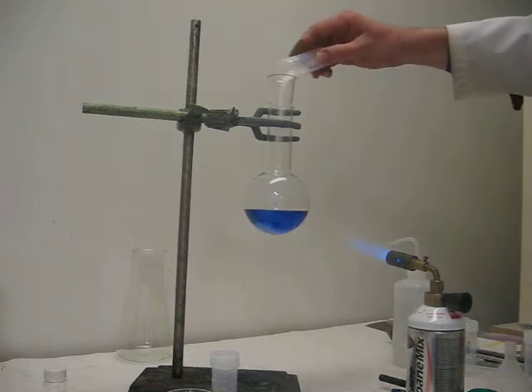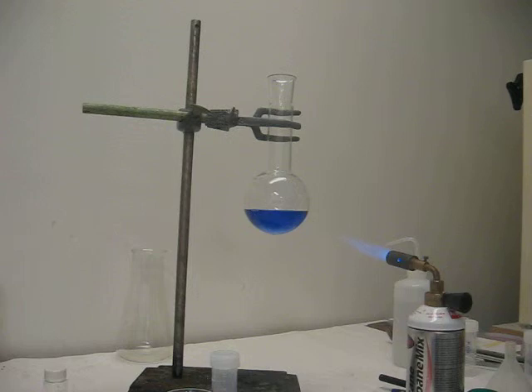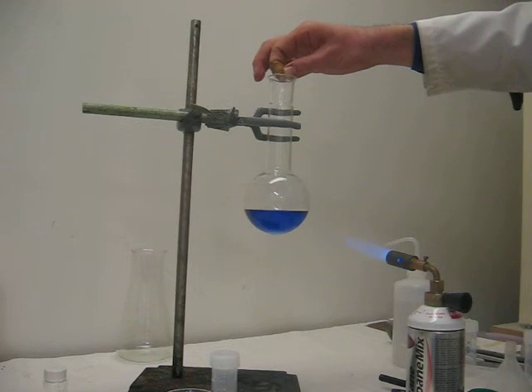We just add some sugar now to that. We can now heat it and see what happens. Before we heat it we will add some anti-bumping chips just to ensure it boils smoothly.